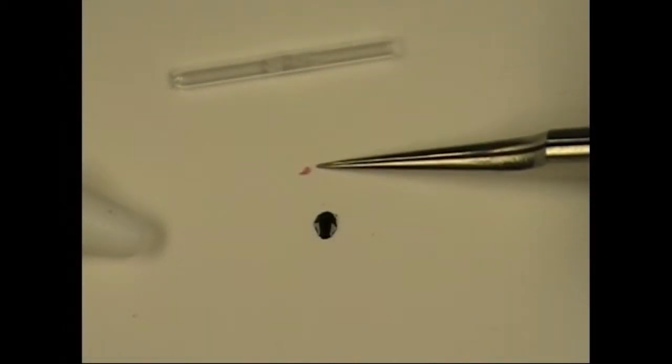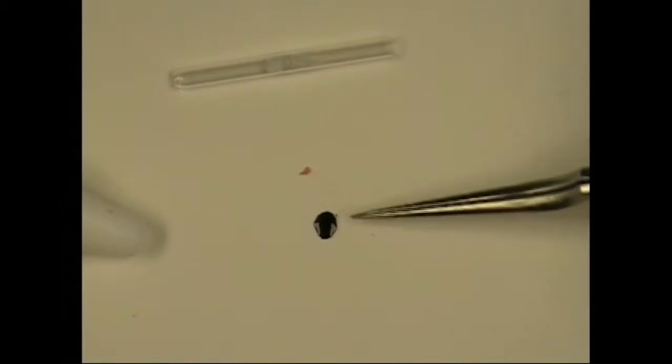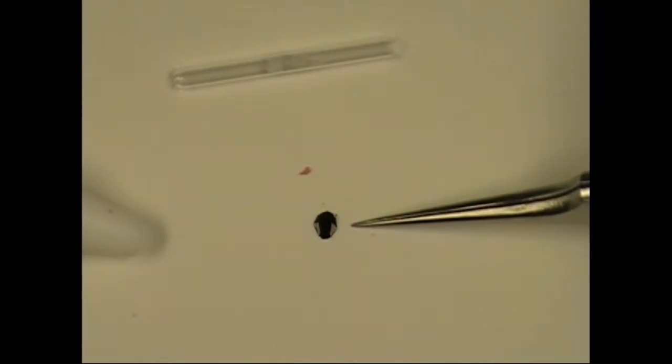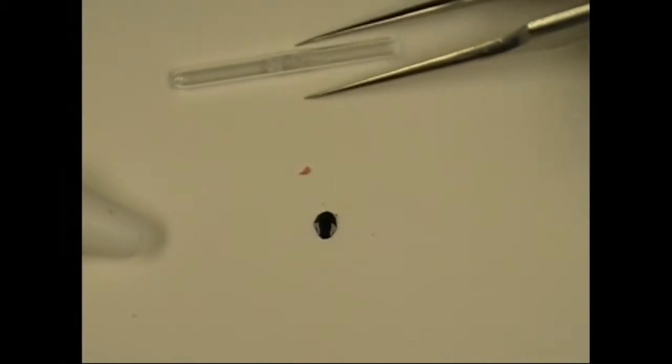Once you've cut the sample the size you want it, this is the sample I'm going to analyze, and this again is about a milligram of material. To give you a rough idea, we want about one-tenth of that or less.